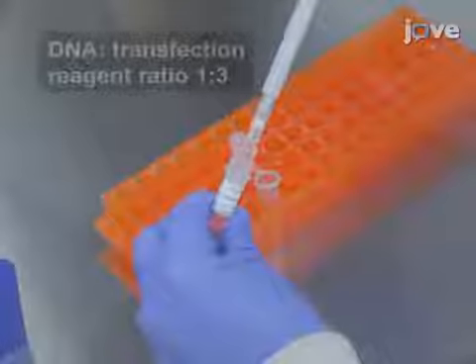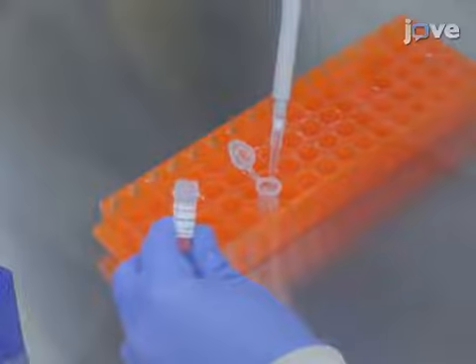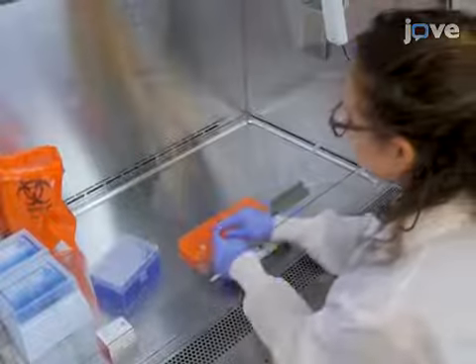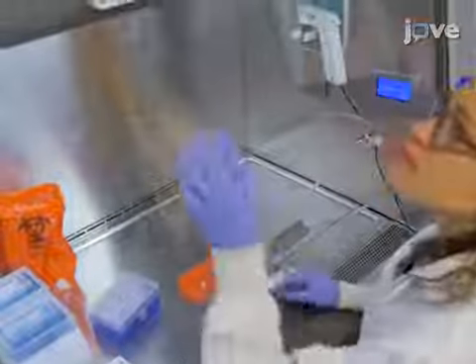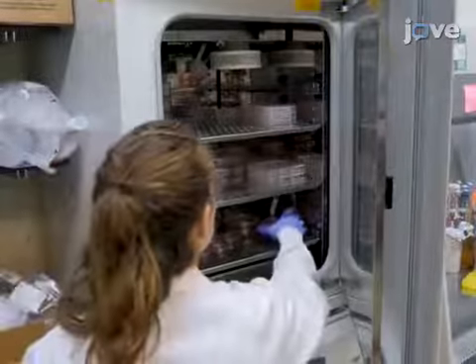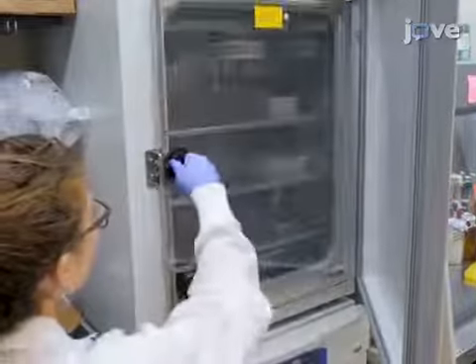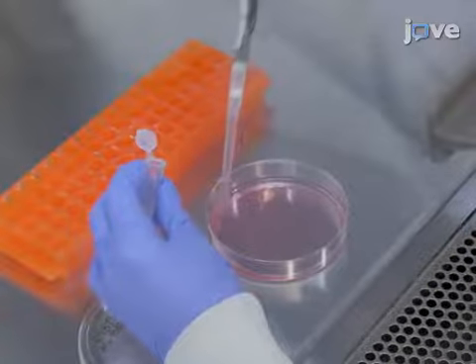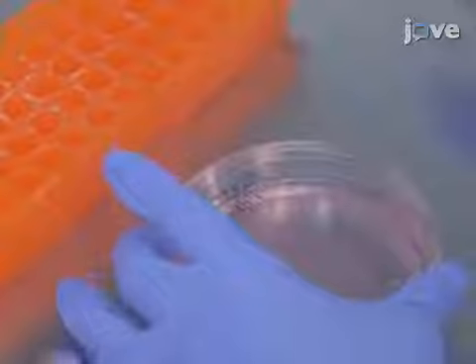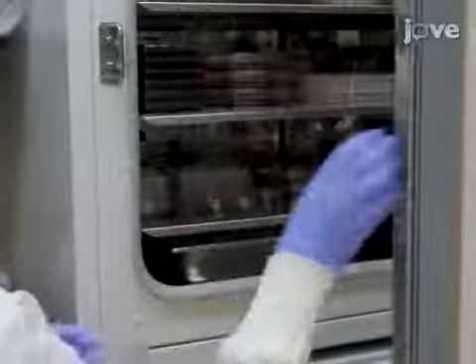After 5 minutes, add 48 microliters of the transfection reagent into this tube and mix gently by pipetting. Subsequently, incubate this mixture at room temperature for at least 15 minutes. Once the incubation is complete, remove the plate with HEK293 T cells from the incubator. Add the prepared DNA transfection reagent mixture dropwise onto the cells and gently swirl the plate to ensure even distribution in the plate. Place the plate back into the incubator.